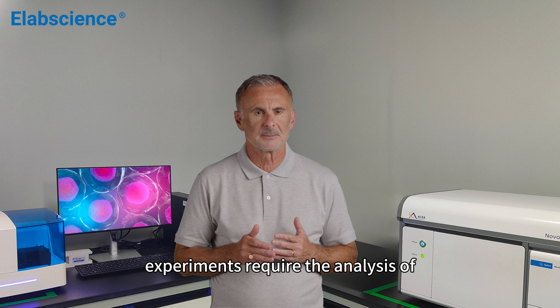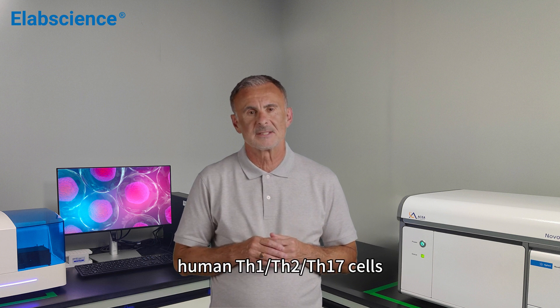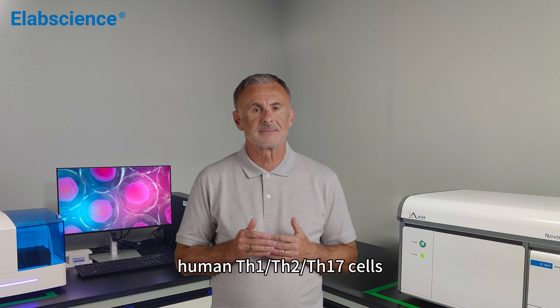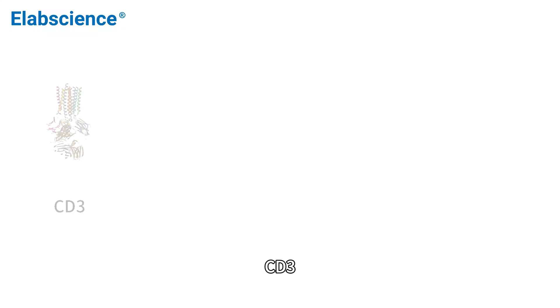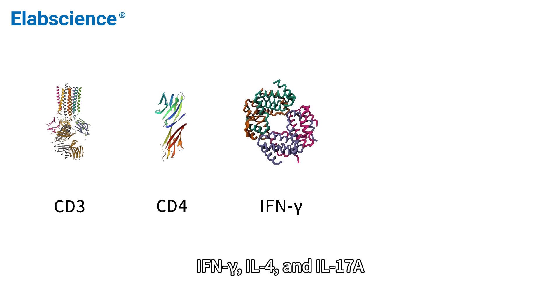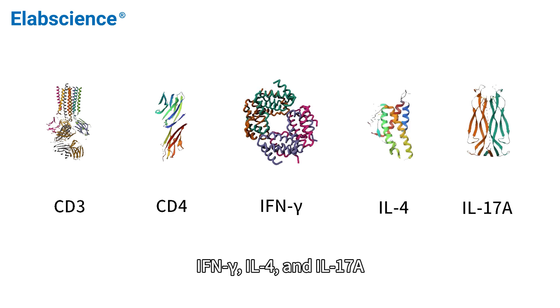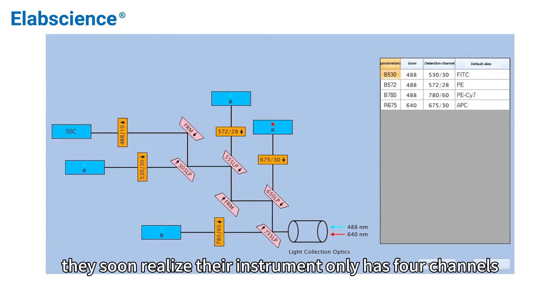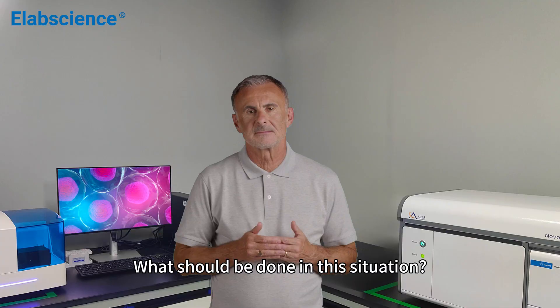For instance, an experiment requires the analysis of human Th1/Th2/Th17 cells and selects the following five markers: CD3, CD4, IFN-gamma, IL4, and IL17A. However, they soon realize their instrument only has four channels. What should be done in this situation?